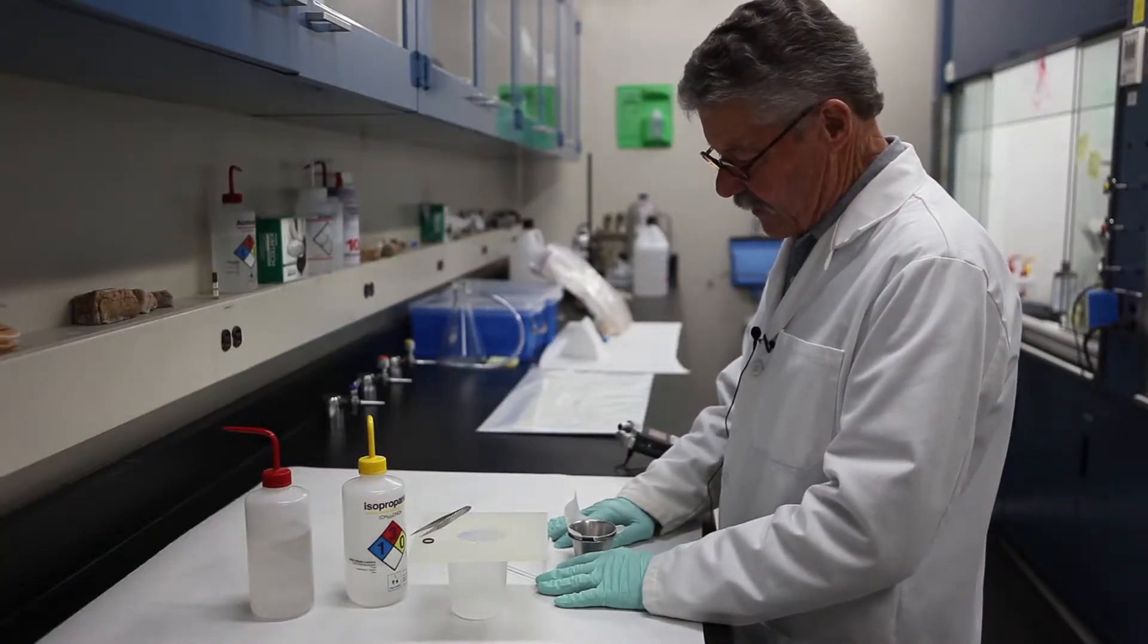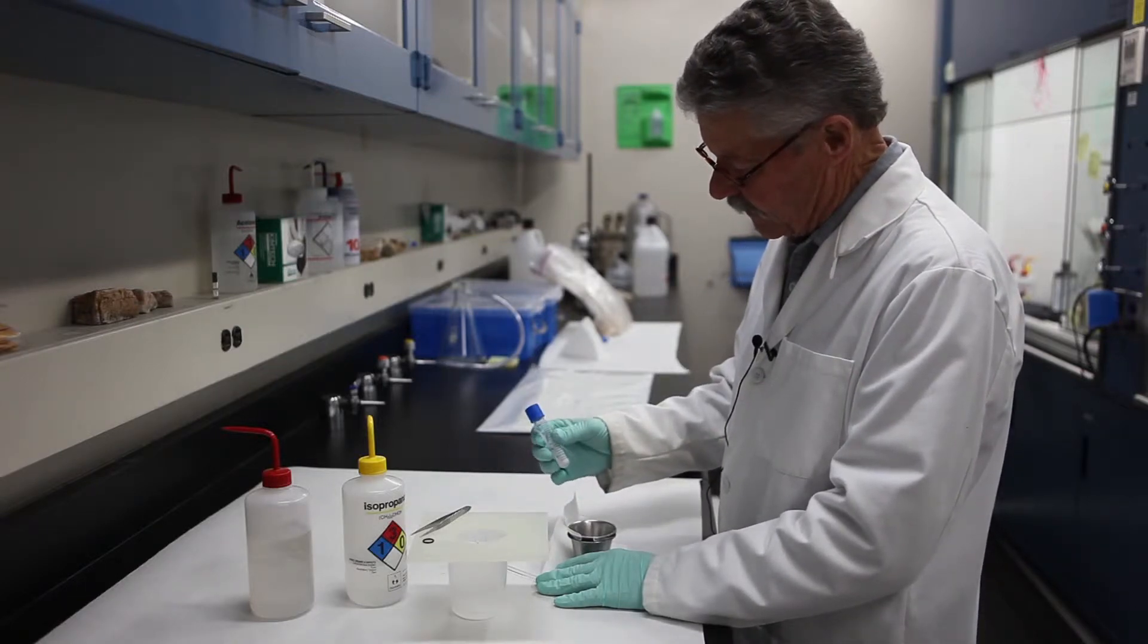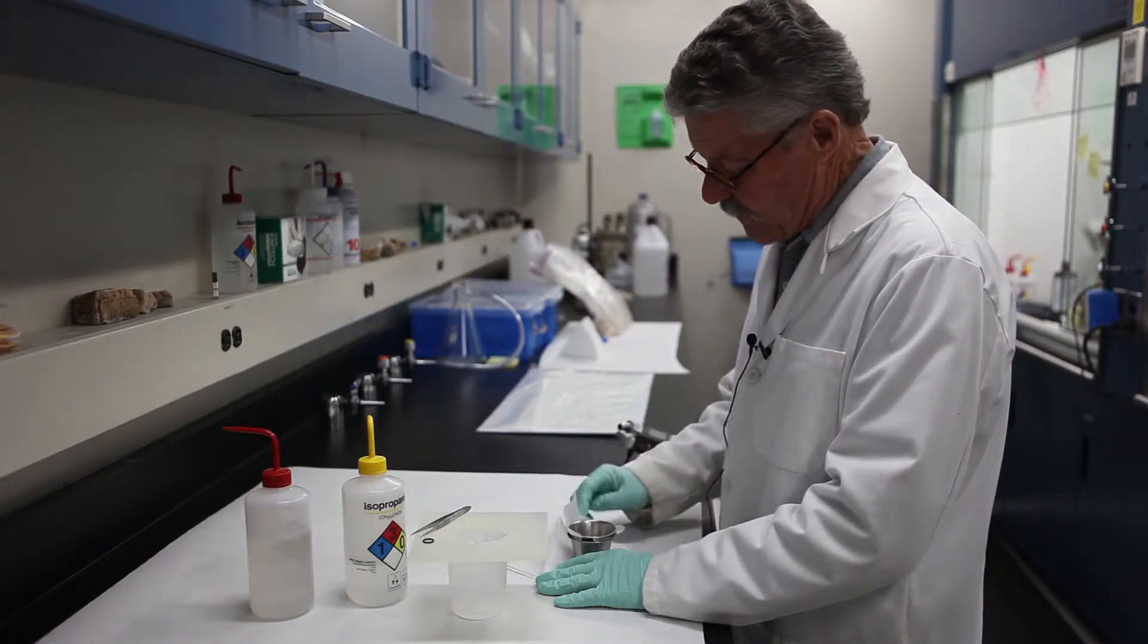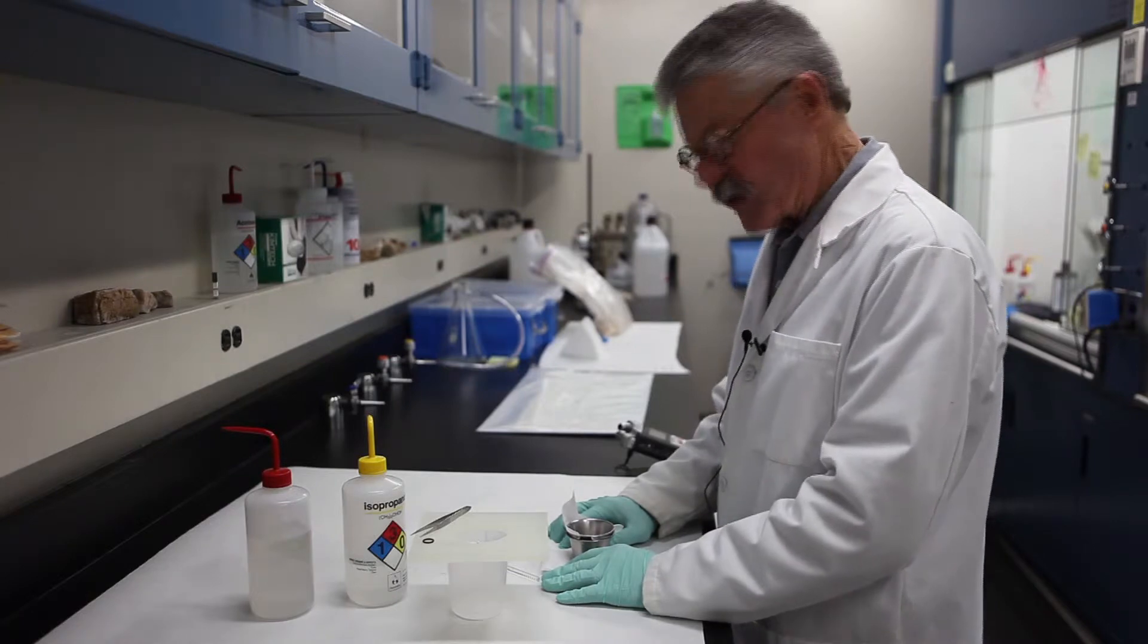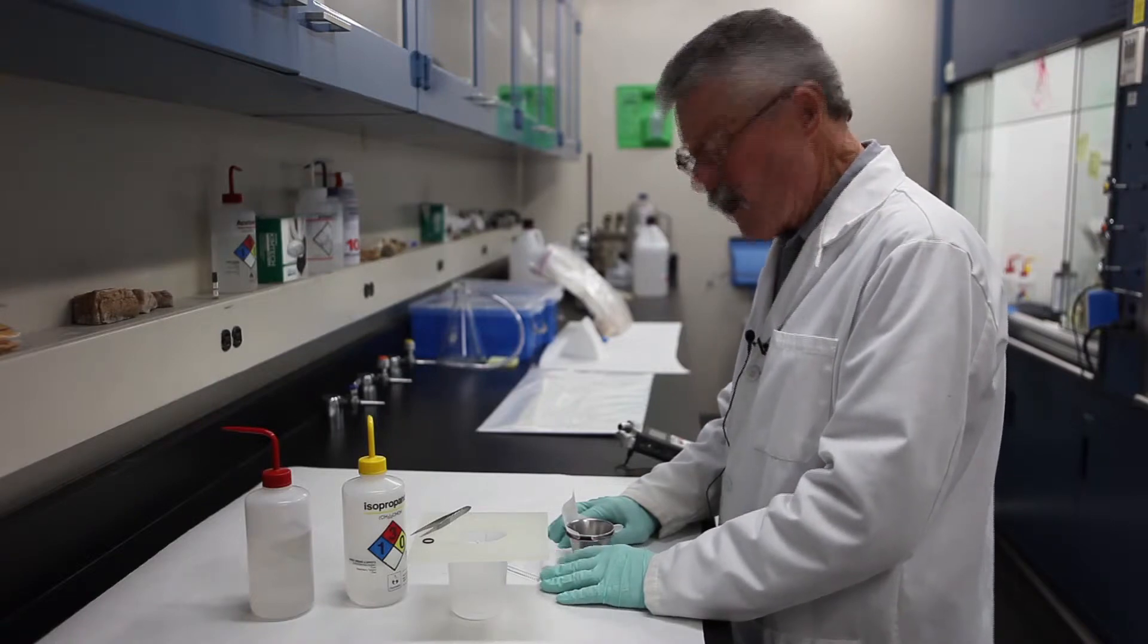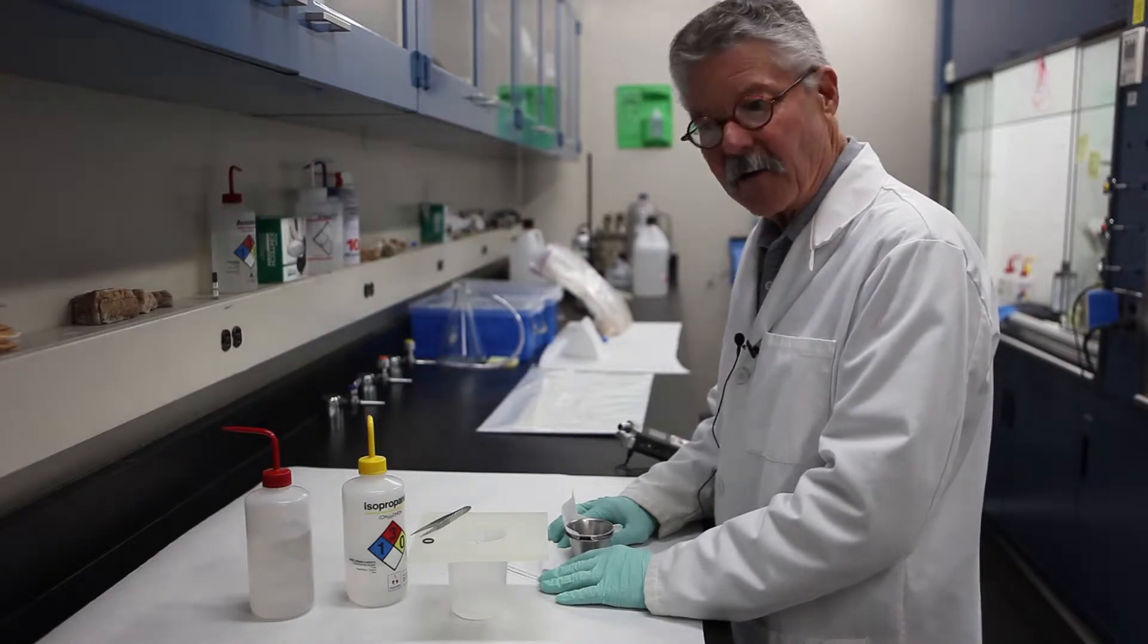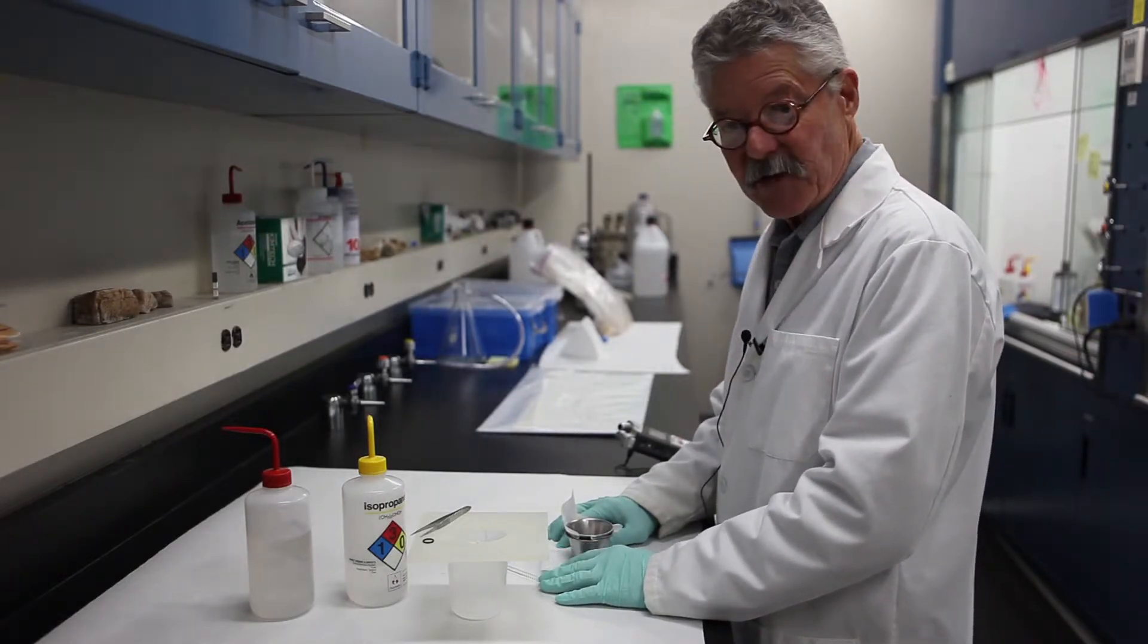Now the sample is still drying, not quite dry yet. This particular sample had a tremendous amount of barite and what's going to have to happen now that once this is dry, we will run it through the Wigglebug a second time. And if it's necessary, if all the barite is not gone or the other soft minerals, we'll run it through a third time, whatever's necessary to get rid of all of the clutter or the extraneous minerals that we do not want in the sample.